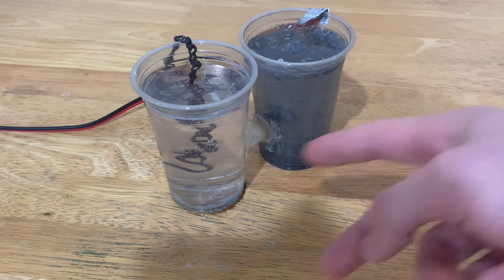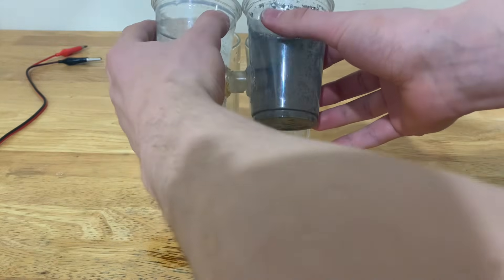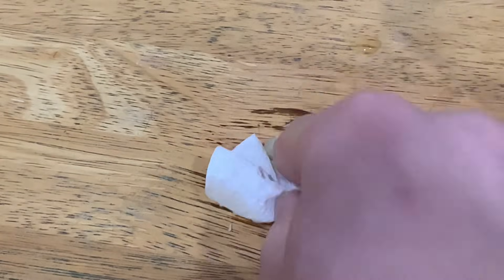Now that the process has been going on for a while, I'll just pour this out into cups. Now I'm just going to pour this out nice and easy — and this does not look good. I might have just trashed the table. This is what happens when you pour sodium hydroxide onto the table. I genuinely just trashed the table — this is not coming off.